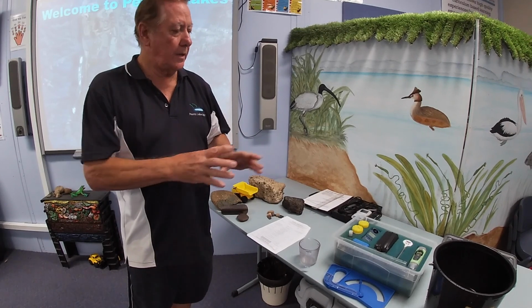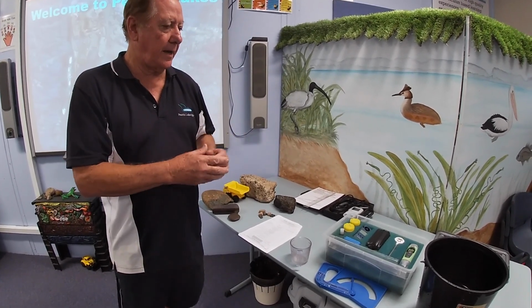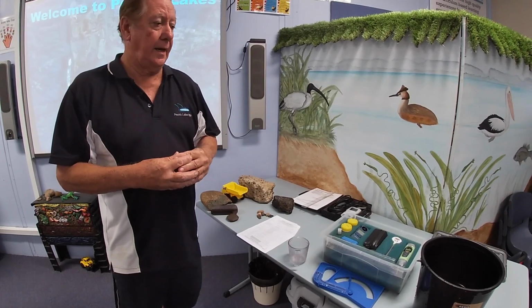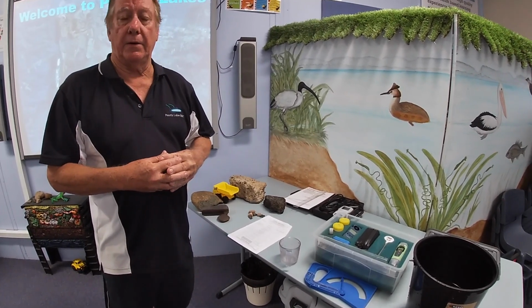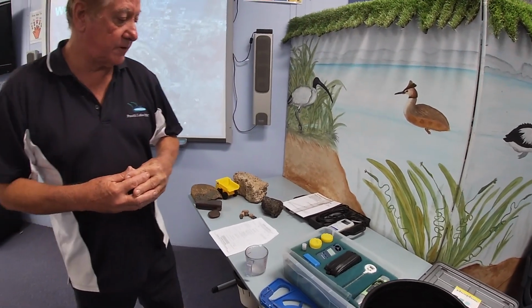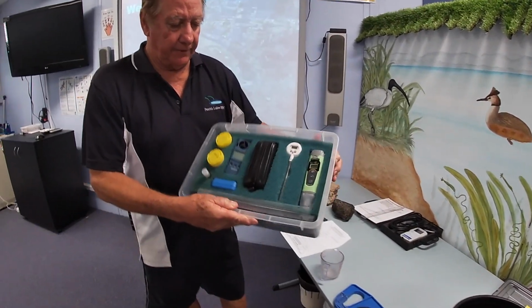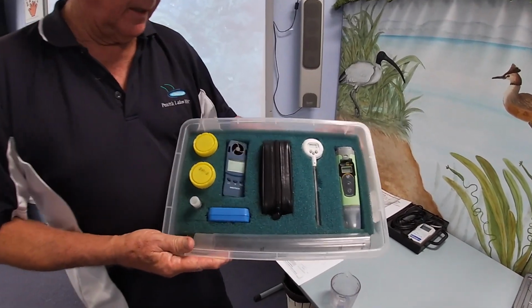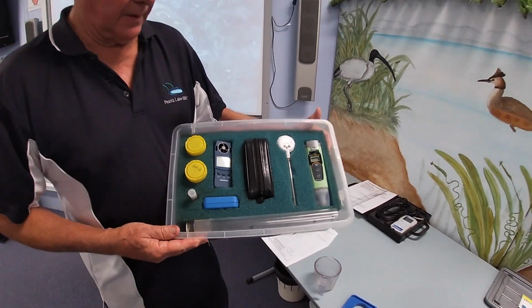But first of all, you don't know how to do these tests. So I've got to go through step by step and just show you how physically to do the test, and also at the same time I'll just outline why we're doing the test. So the first test we're going to look at is phosphate, and the kits are given in the field. They look like this, and basically they have a number of instruments in it.